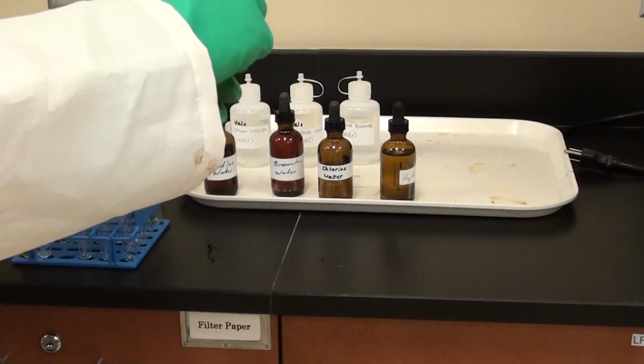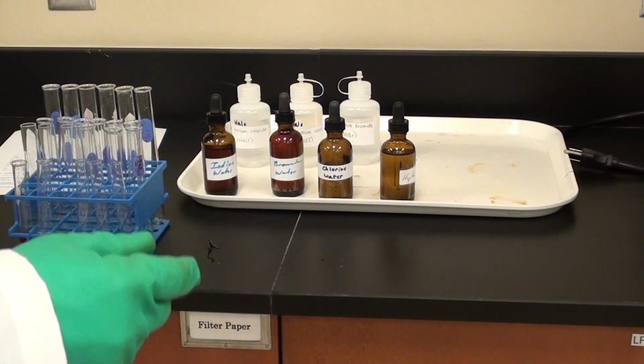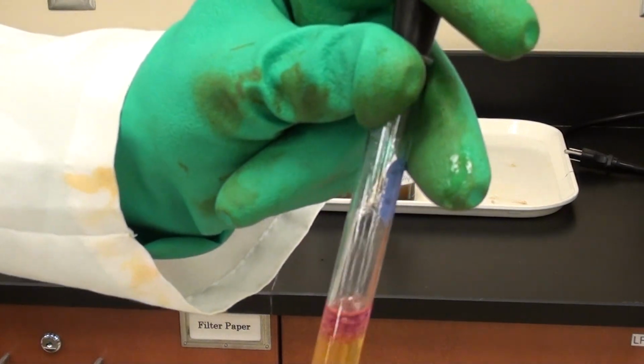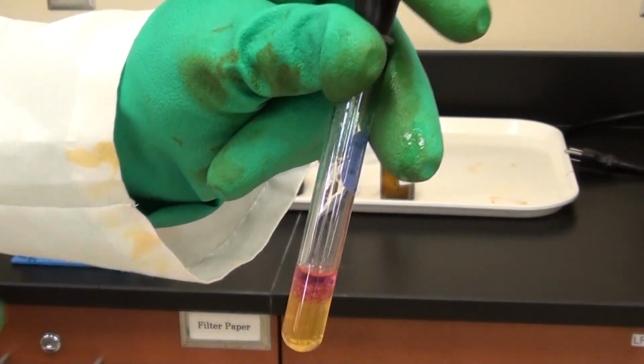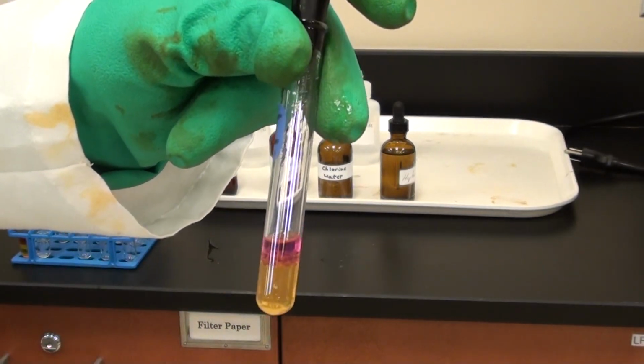Yeah, it looks like I preempted myself here. It looks like the top layer turns this pinkish color. See, that's why we're only interested in the top layer. Can you put that down in front of the camera? There we go. Take a look at that top layer. Really clear that it's a very nice pink color. It's good. All right, thank you.